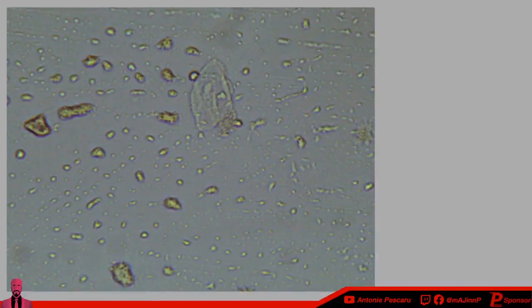And these aren't the one. Oh, there's one actually, but it's on top of everything. The dust and the water is on top of it, so you can't really see it well. It's right here.